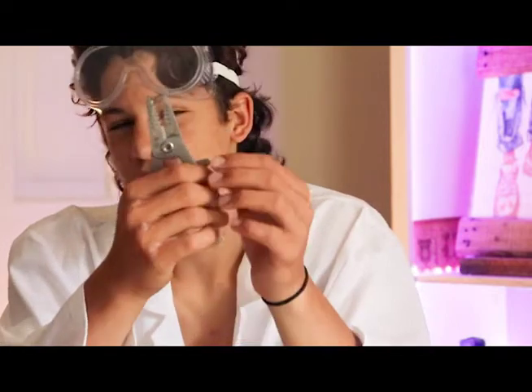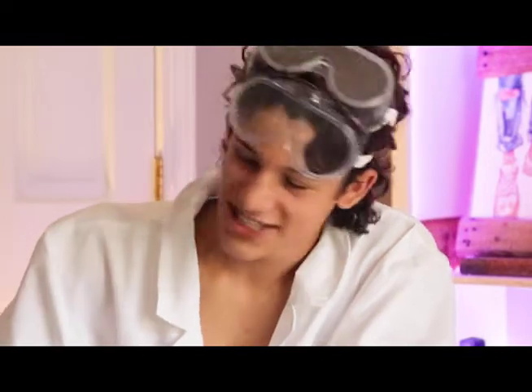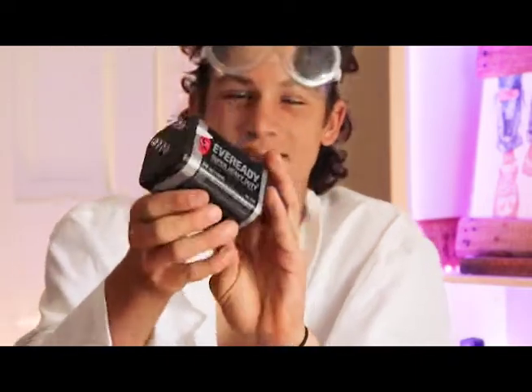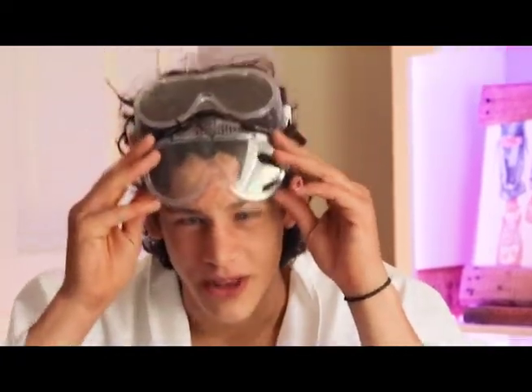The next thing you're going to need is some scissors or wire cutters. Today I'm using wire cutters to strip the insulation from my wires. Next you're going to need a teaspoon to measure your baking soda. Next you're going to need a 100 milliliter beaker or small glass. Next you're going to need a 9 or 6 volt battery — this is a 6 volt. Be careful that you don't use a battery that you plug into an electrical outlet, because it clearly says in your textbook that it will easily kill you. And believe me, I have experience in that area. Next you're going to need safety goggles — and I would prefer you to have two, because I care about you, and not only your eyes, but your forehead and hair as well.